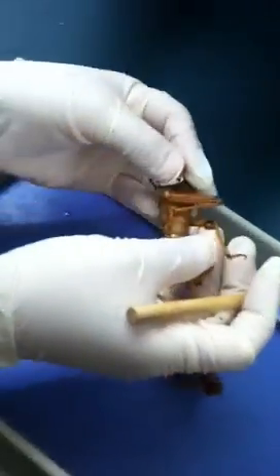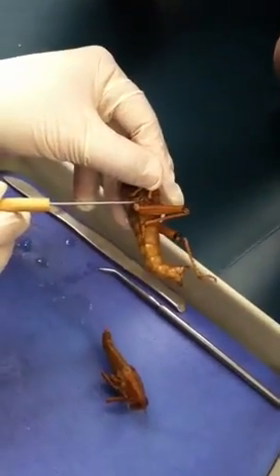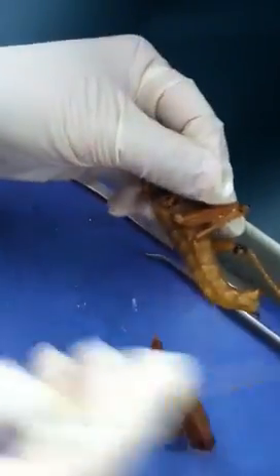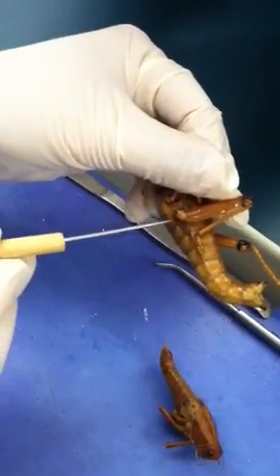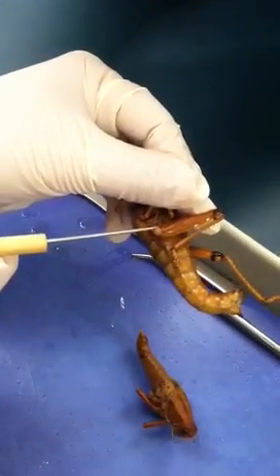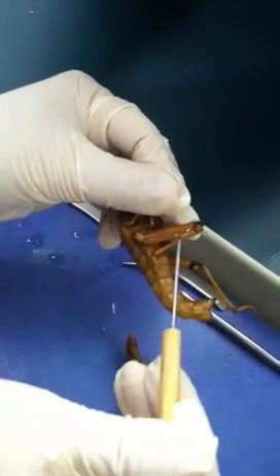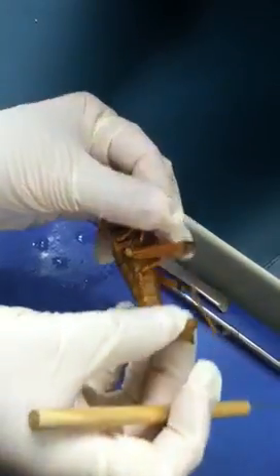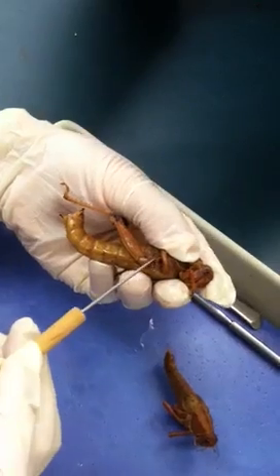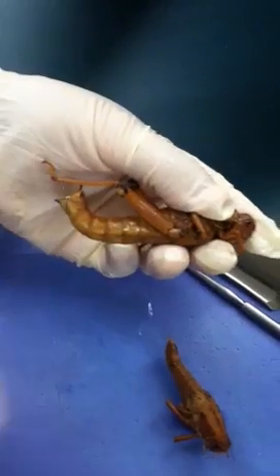After the abdomen, we need to talk about the foot. You will see a wrapping swollen area that looks like a crazy-shaped structure — that's what we call the coxa, C-O-X-A. The joint being wrapped by the coxa is what we call the trochanter. After the trochanter, it's just like a human: femur, tibia, tarsus. On this side is a better orientation — the same: wrapping is the coxa, then trochanter, femur, tibia, tarsus.